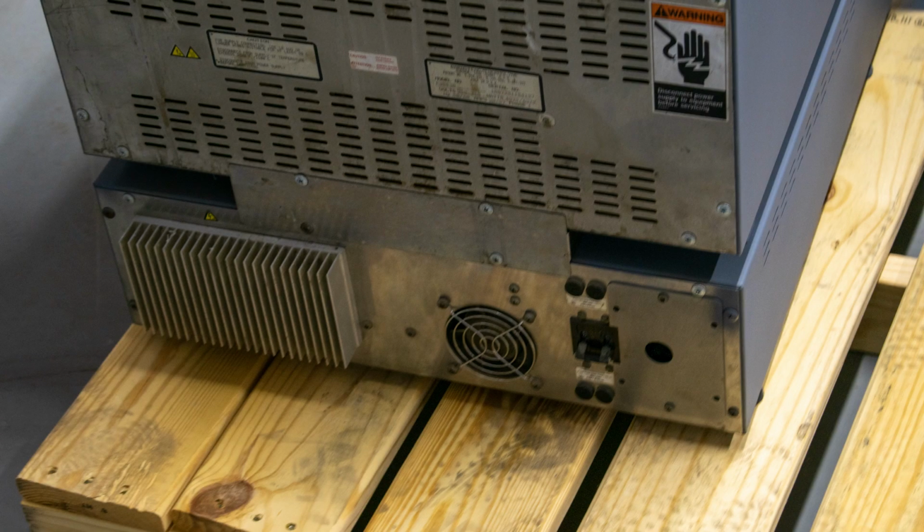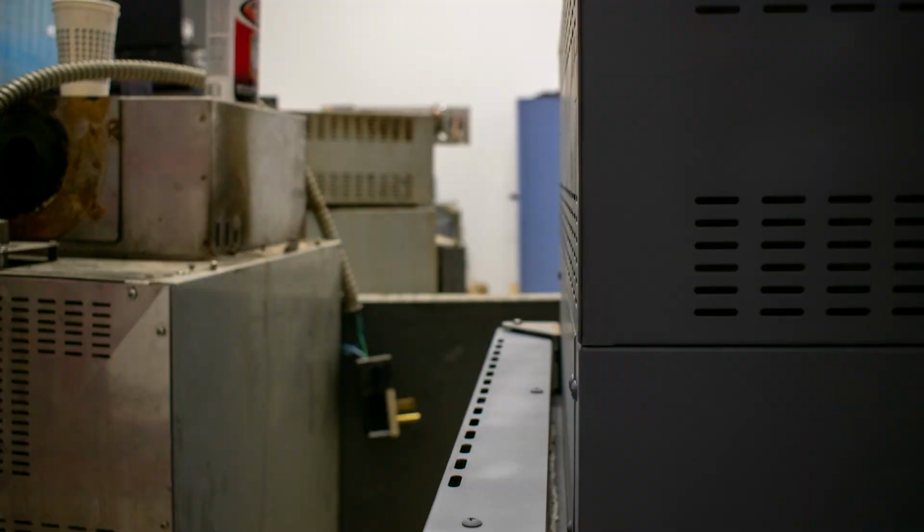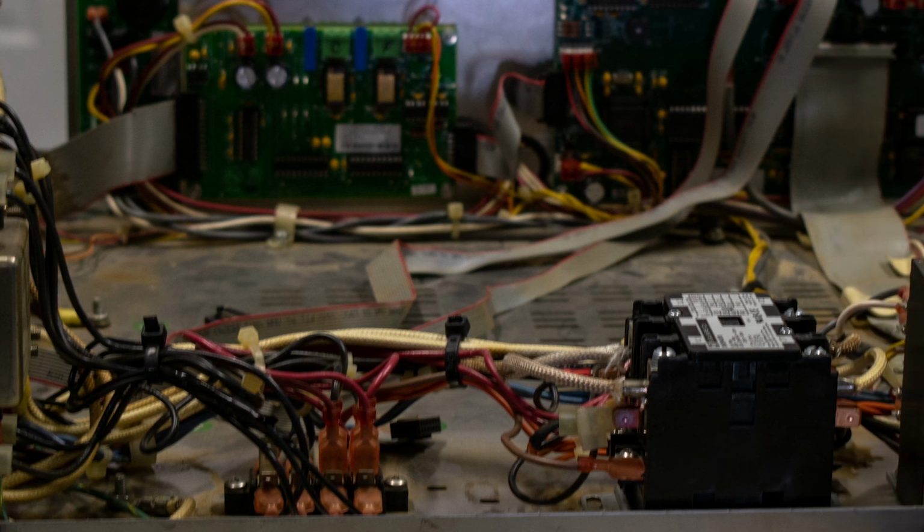Normally, I'd say you have to wait. But fortunately, we have some good news. We have refurbished NCATs in stock and ready to ship immediately. We also offer the same warranty as a brand new unit. You get a year on parts and a year on labor.